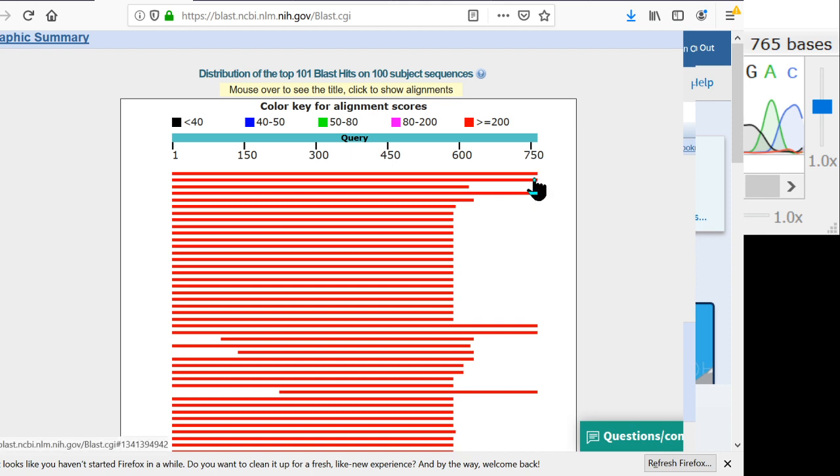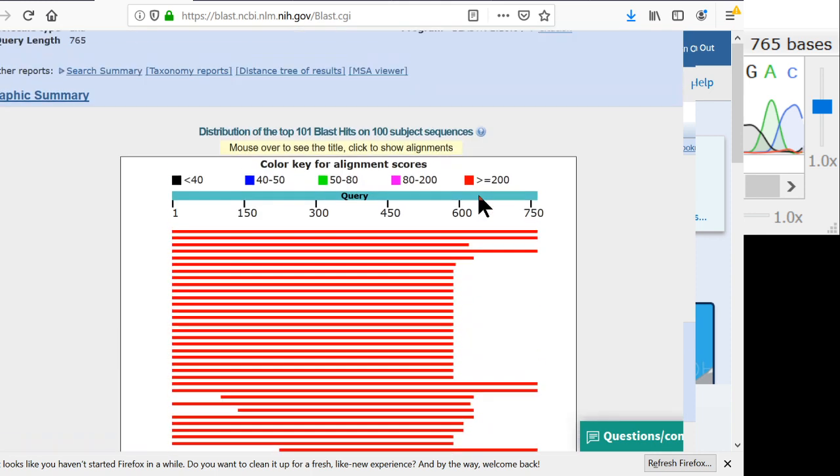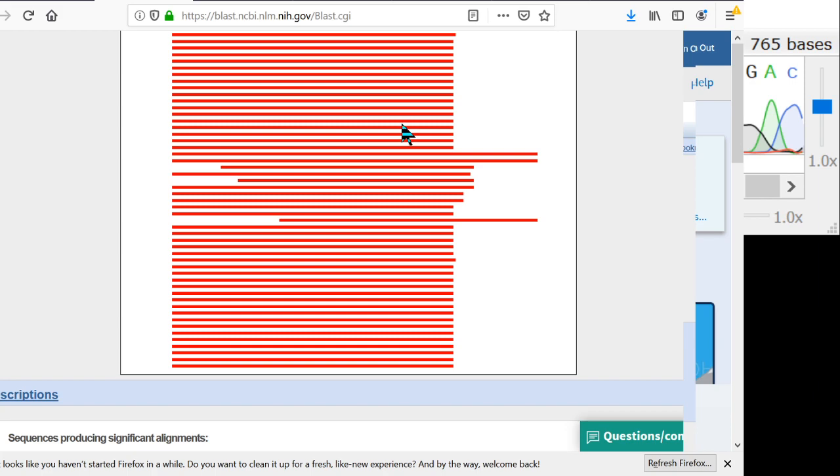You can see that the top couple query matches have longer sequences, but then they quickly go down to the shorter sequences. But 600 characters is really a lot of data. It's like 600 character states with 4 possibilities. So every mushroom will have a unique barcode in here, and we don't really need all 800 to be confident of what we have.